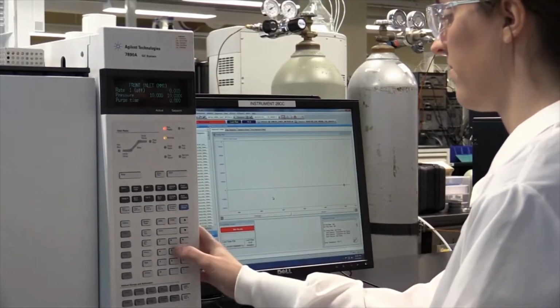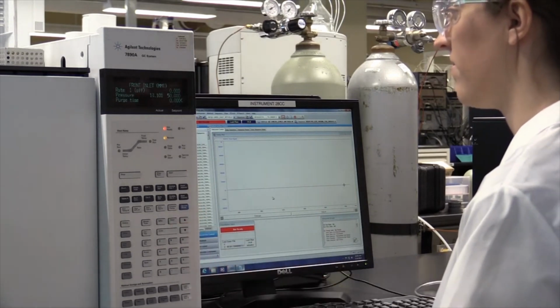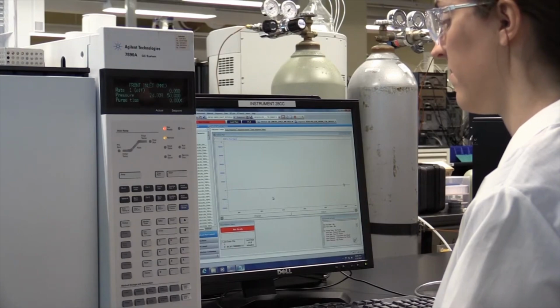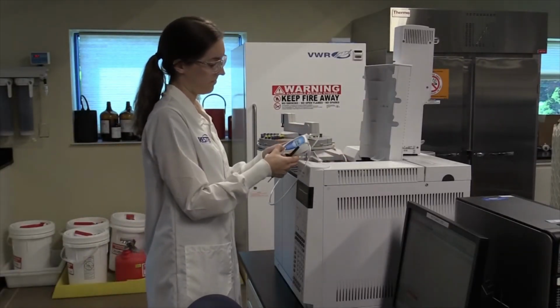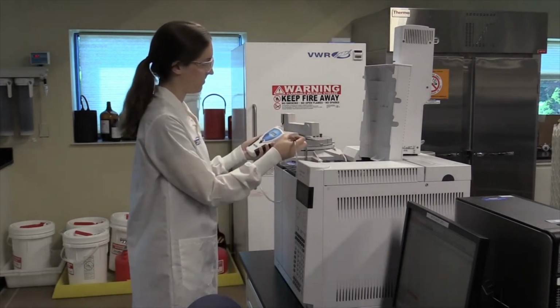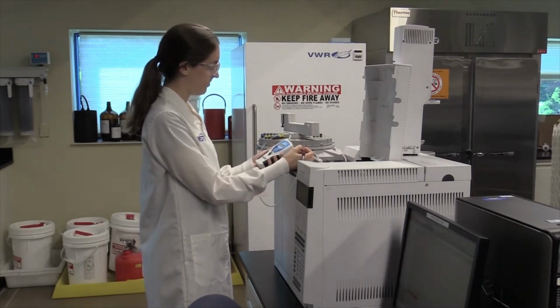Prior to leak checking a GC, we recommend that you increase system pressure while the GC is cool to accentuate any potential leaks and make them easier to detect. Then, after bringing the system up to operating temperature, be sure to recheck critical seals.